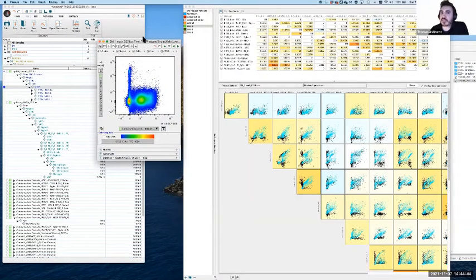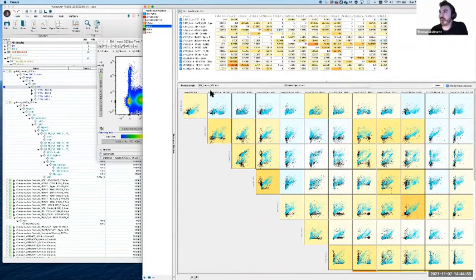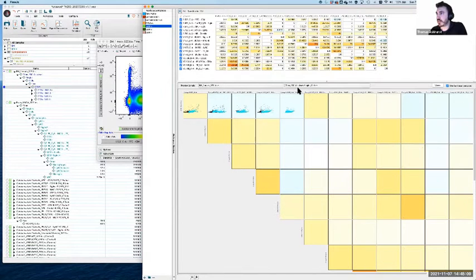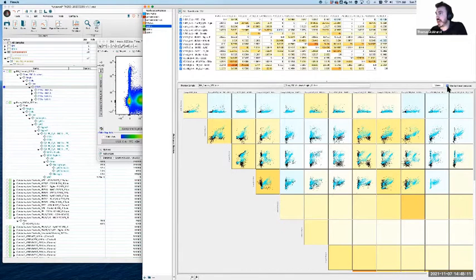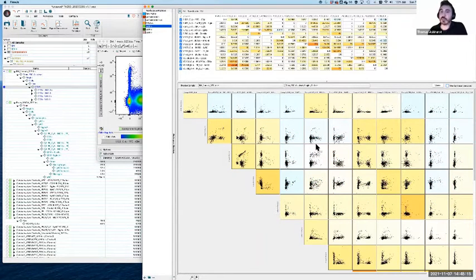Now, one option that you can use to find where there might be compensation errors is to use this tool down here, the N by N matrix. This is quite helpful, but I must admit I often find it's not really what I need, but it's definitely of value nonetheless. So what we can do here, for instance, is if we've selected a matrix, we can choose a sample and a population. So let's say our cells. And then we can look at, in this case, the blue is the uncompensated. And if I turn that off, underneath it, the black is the compensated.